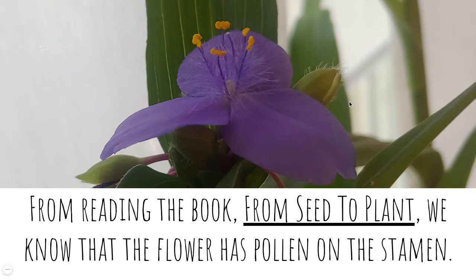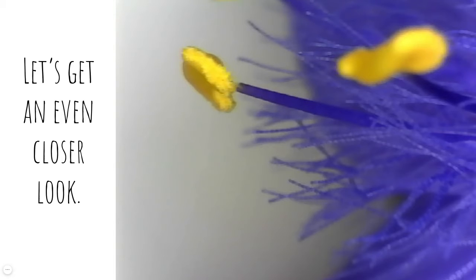And here's our spiderwort again. Can you see the stamens? There are all these little bits with the yellow on them. That's the pollen. Let's get an even closer look. So the ends of the stamen look a little fuzzy.